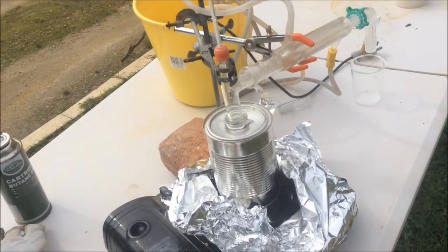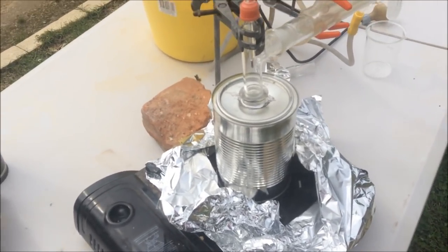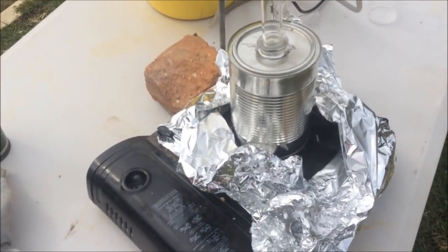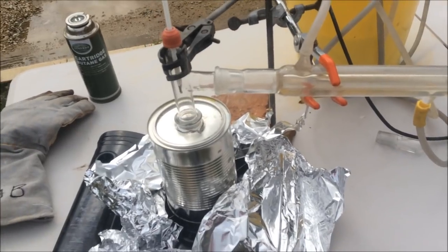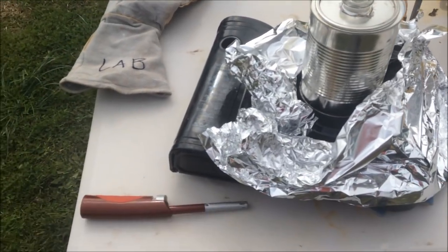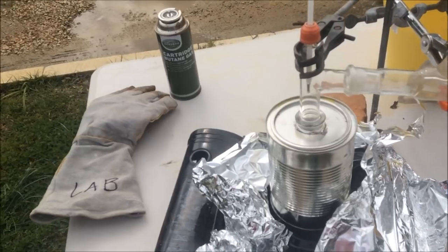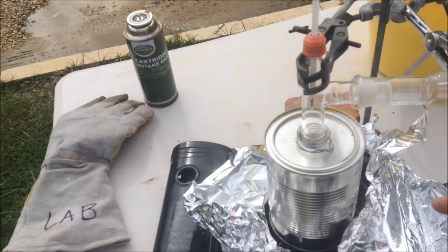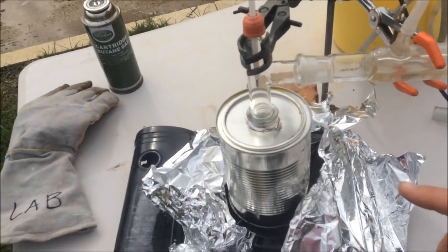Alright, this is starting to be horrific. It's bumping so violently, it's actually sort of forcing that lid off. And at any moment it can sort of fall off and do things. And the stuff isn't really distilling over. But we're going to have to stop this because this is not going anywhere. I'm also going to run out of gas. But yeah, we're going to have to approach this a different way because this seal isn't really holding, it's just aggressively boiling at the bottom and aggressively bumping.